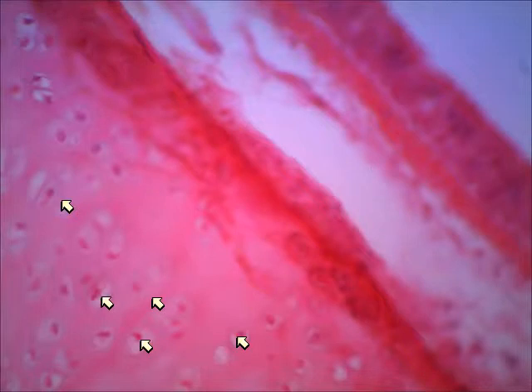Now, on this next slide, here we see it on high power magnification. I noticed when I was looking at this slide that if I focused on the cartilage, as you can see over here on the left, there's the cartilage. You can see the lacunae, which are the cavities, and then the little cells inside the cavities are the chondrocytes. But if I focused on that, then the epithelium that you see in the upper right was blurry, and that's because they're at different depths on this particular slide. It wasn't sectioned so it showed them at the same depth.